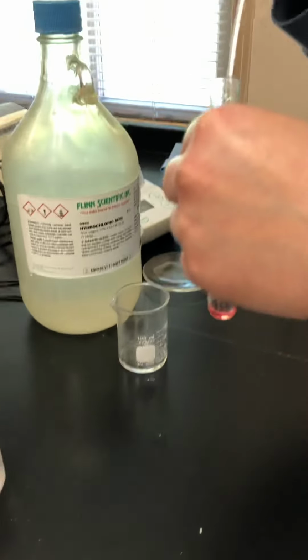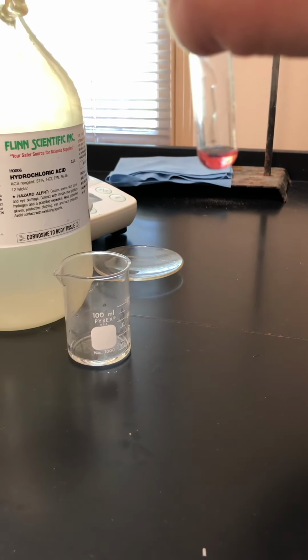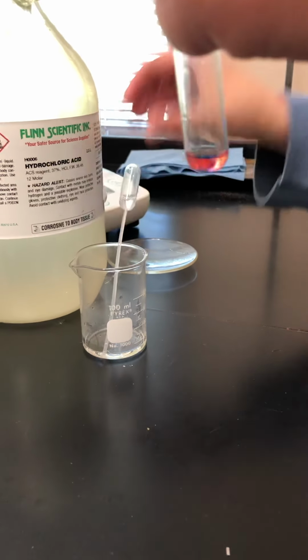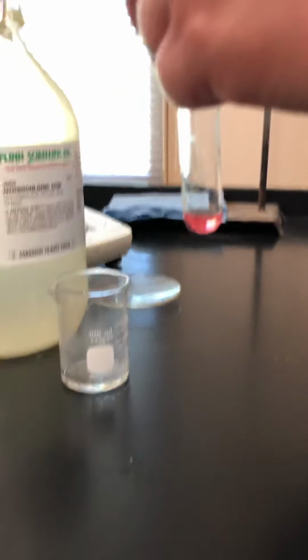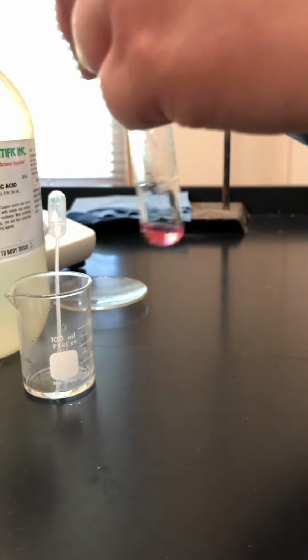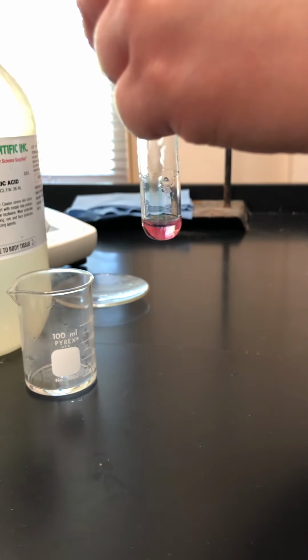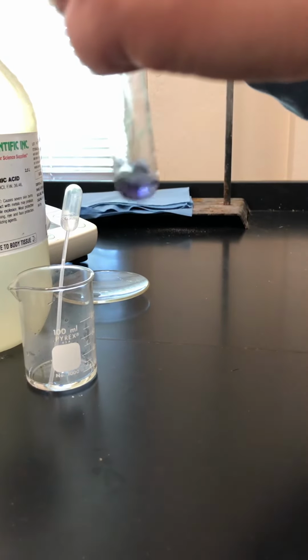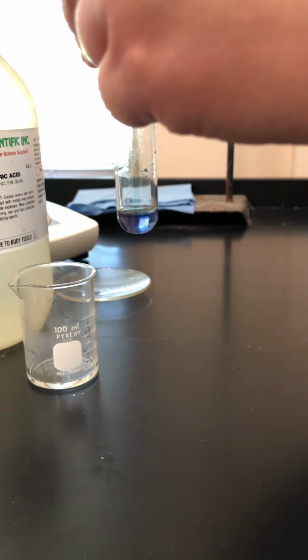Okay, so there's the first drop. There's another one. I see something happening. I'm just going to add 1 more for good measure and maybe give it a shake. Oops. All right, let me add more. You have to shake it after every one, because even though you see a color change immediately, it might not persist. So I'll keep adding this. I added a few extra drops and didn't shake it, but I think we're getting there a little more. Let me put in maybe 1 or 2 more just to really drive home that point.